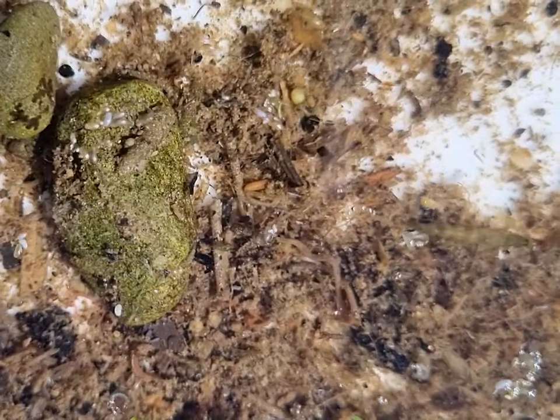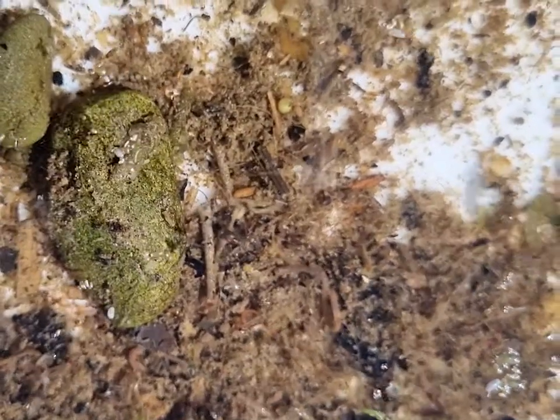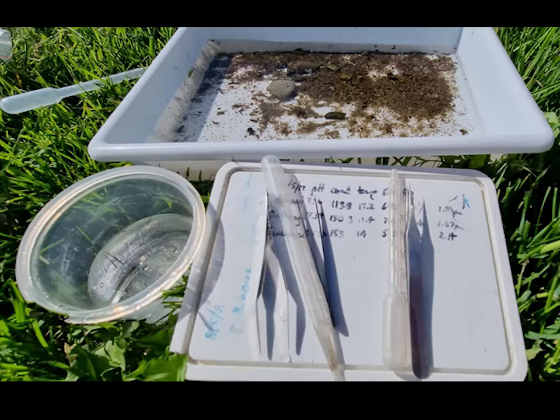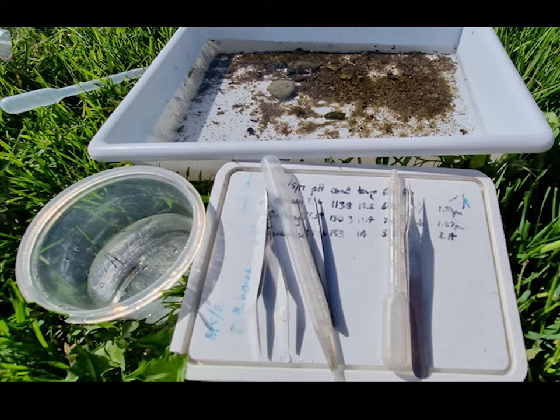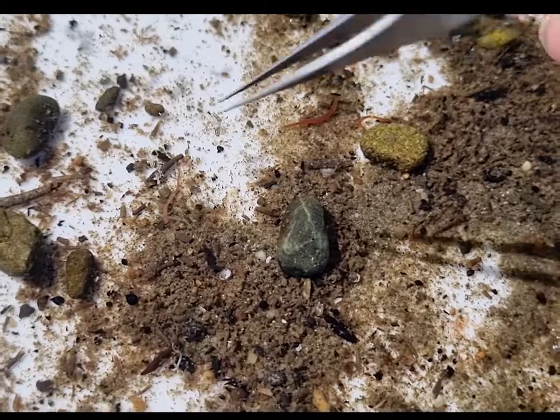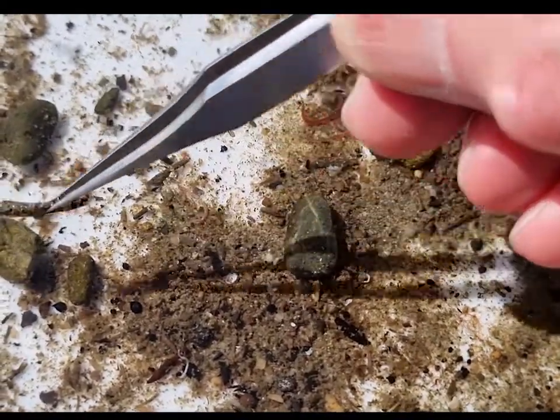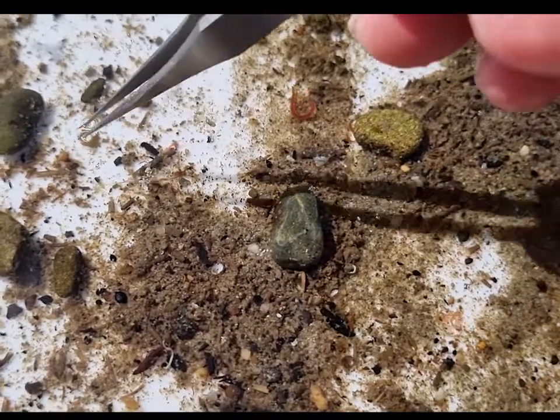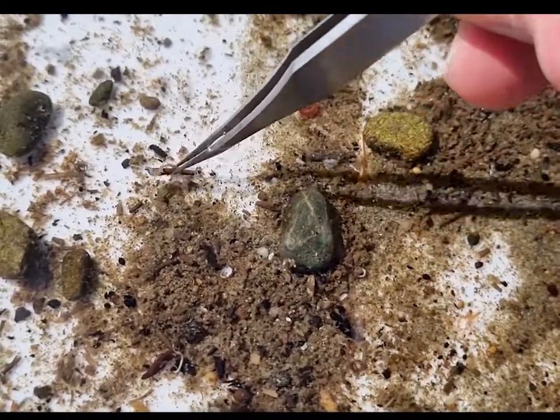Some people actually pick in the field, so they take live samples. You need a little bit of gear to do that if you're going to pick live in the field, and one of the real advantages of picking animals when they're alive is that they're moving, so they're a lot easier to see and a lot easier to pick up.